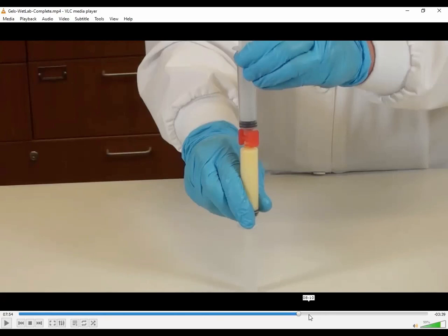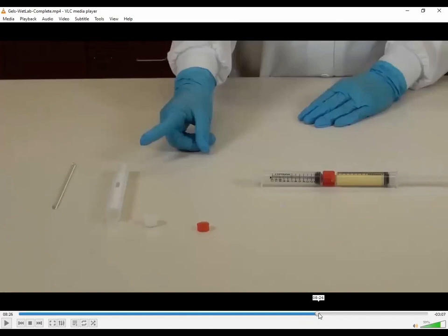Because the reason, now, if you look on the video, we've mixed it back and forth, we want to eventually push all of the product back into that marked syringe. So whichever syringe you marked, when it's done mixing, you're going to put it back into that syringe, remove the tip connector, put it on the scale, and on your worksheet, write down the weight of a filled syringe. Because if you subtract those two, you should be determining the weight of your actual product. So keep in mind, when you're done mixing, be sure you transfer it back into the marked syringe so that you can determine the weight.